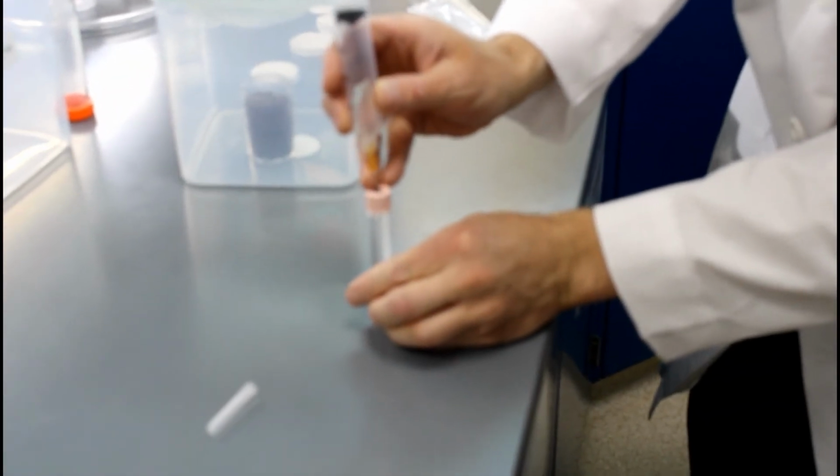Before collecting the gas sample, it's important to make a small gas flow inside the containers to collect a homogeneous gas sample from the incubation box. Normally 20 mL of gas from the incubation box will be sucked out and put into Exetainers for future GC analysis. That GC analysis should be done within 48 hours of gas collection.